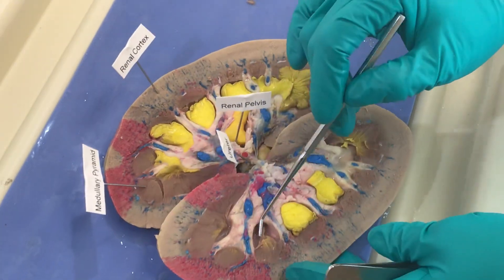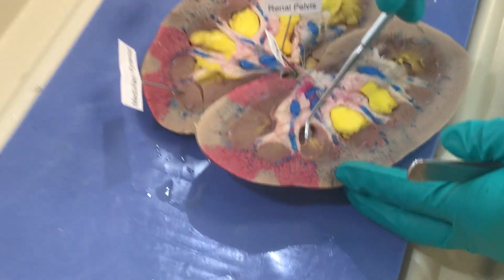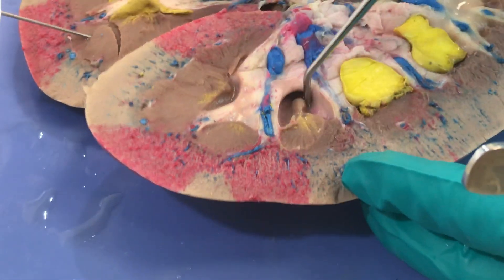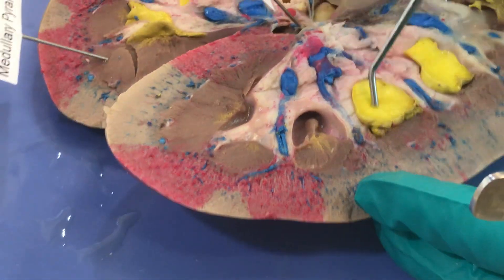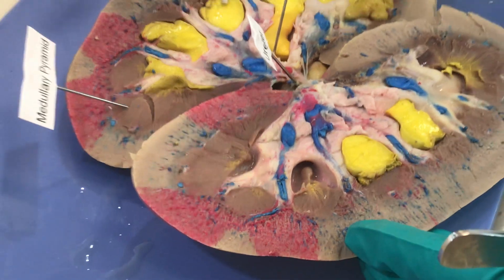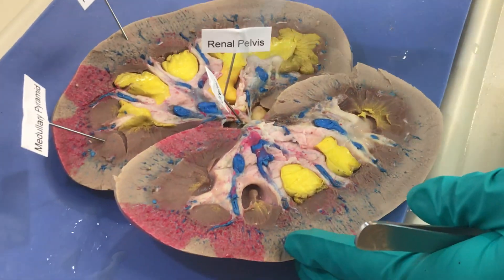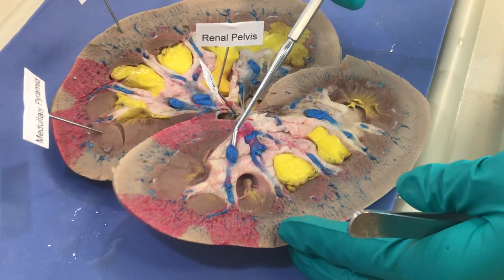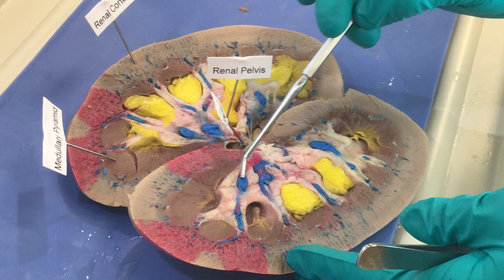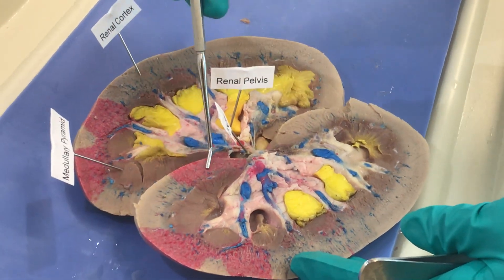This section right here just shows you how the papilla and the urine will be dripping into this space. The yellow stuff is supposed to mimic the urine and the space it would fill, the blue stuff mimics veins, and the red stuff mimics arteries.